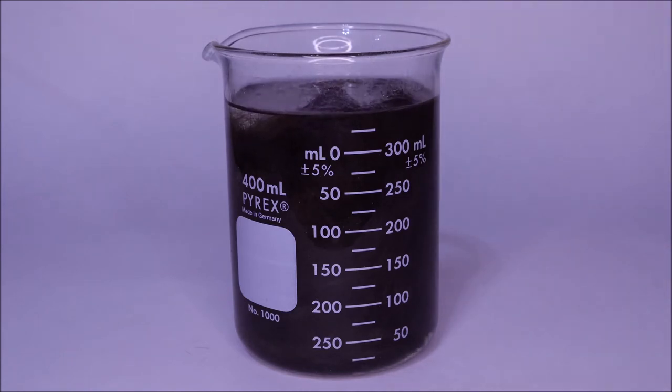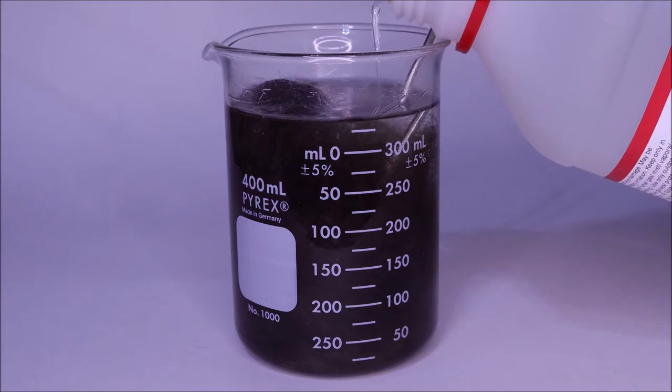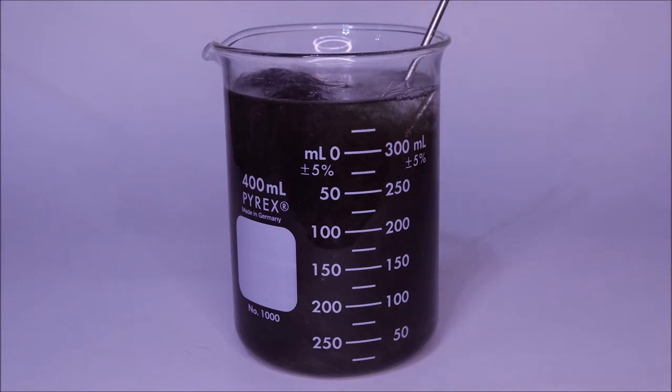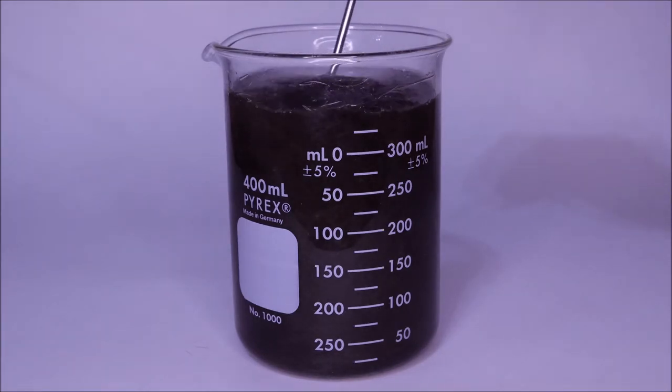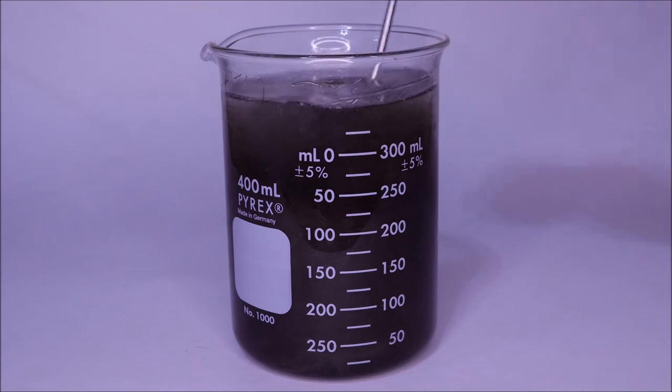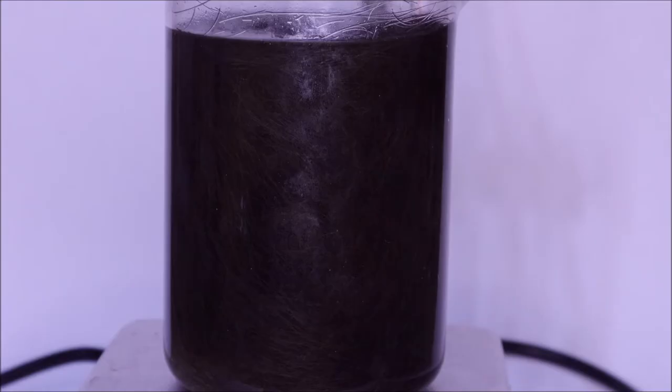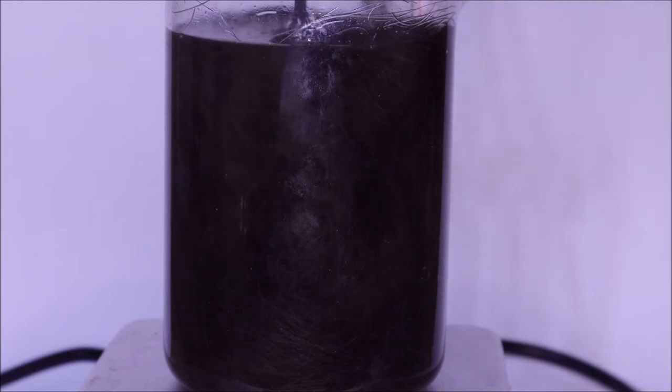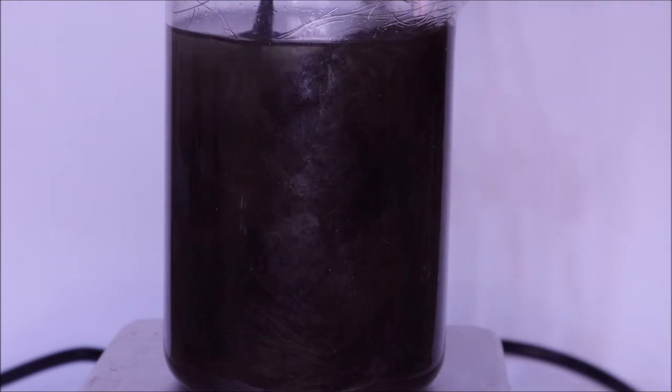If you listen closely, you'll notice there's some kind of faint hissing going on as I add the acid. What's happening is that's heating up the water where I add the acid because that's a very exothermic process. I think there's actually gas that's trying to escape as I pour it. I was targeting a molar concentration of about 6 normal or so.